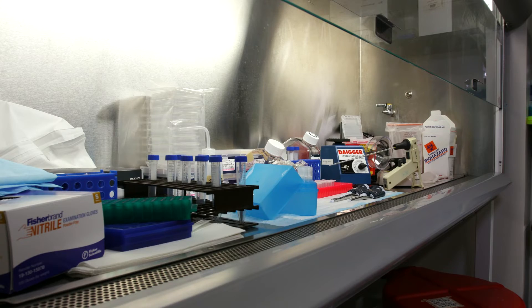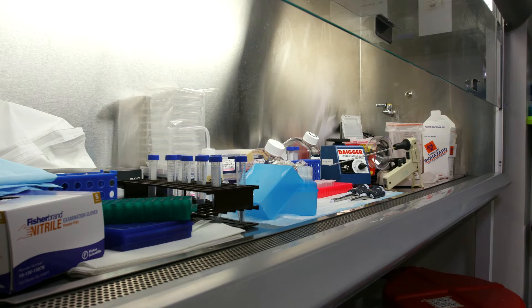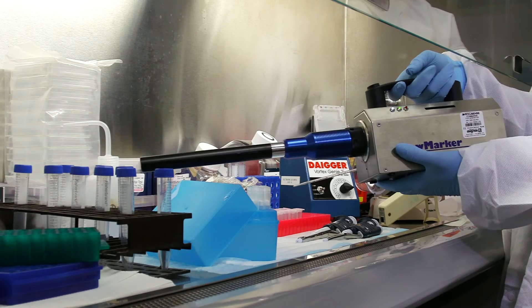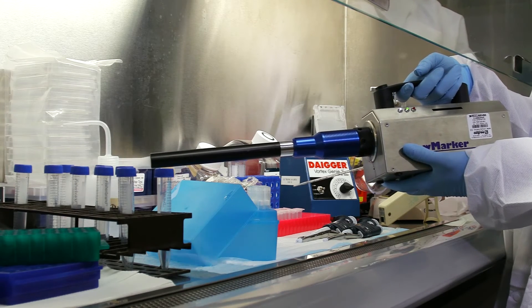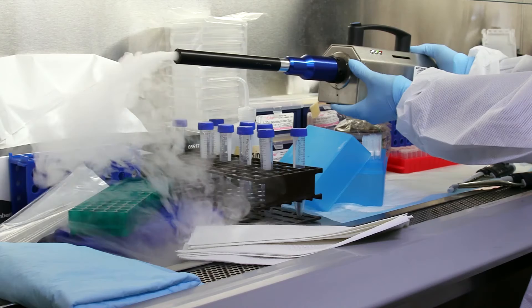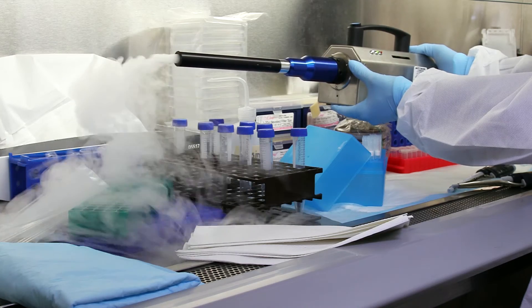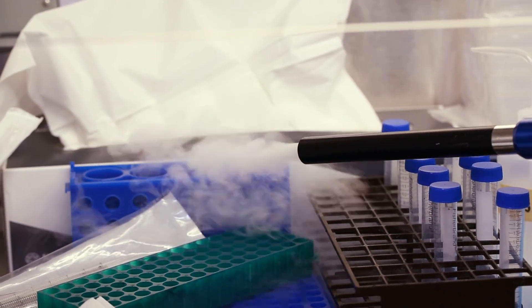One common mistake is overloading the inside of the BSC with too much equipment and or supplies, or covering the front or rear grills.